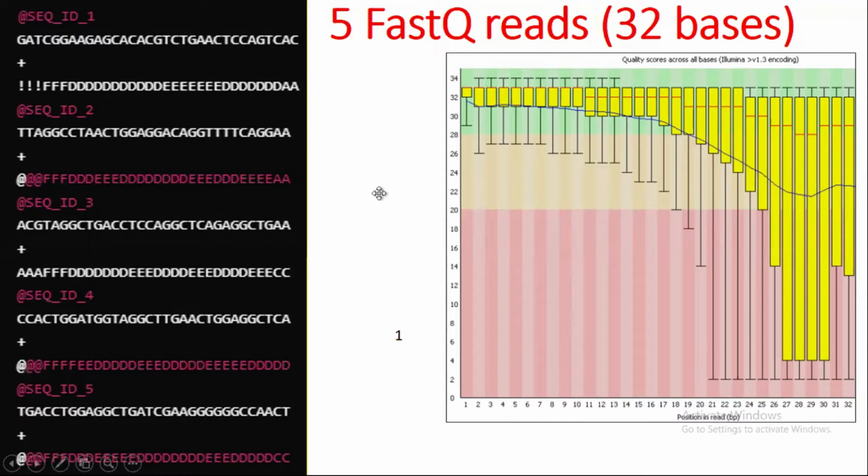I will explain a single one of them. For example, we are looking into the quality of the first base. These are my sequence reads, and this is the quality of each sequence read. It is somewhat arbitrary, but I want to show you how FastQC reads it. I will be dealing with the first box plot, which revolves around the first base pair. We have 32 base pairs, if we count it, so it gives us the quality of the 32 base pairs.